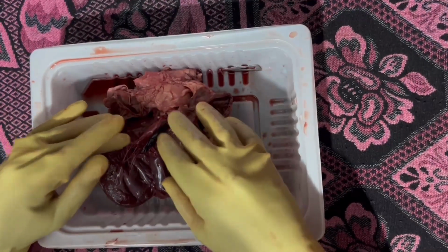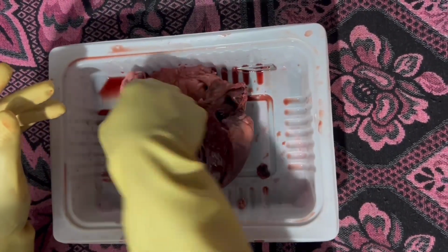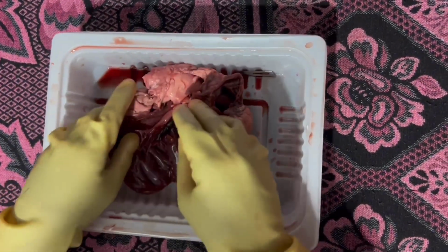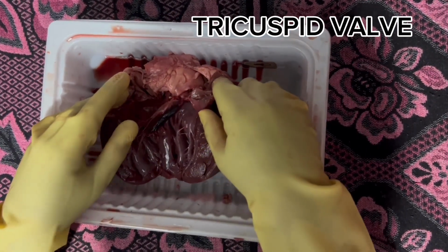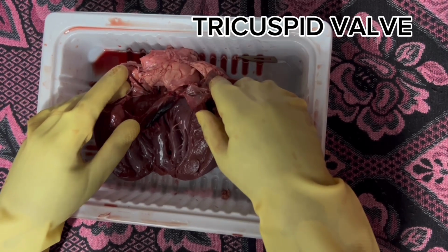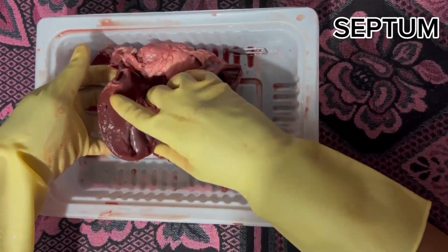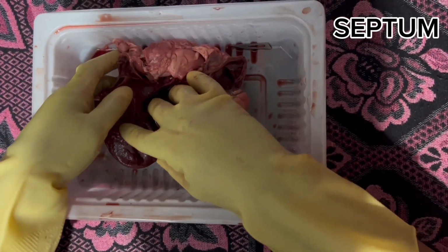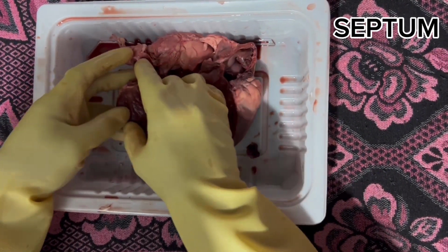This is the internal part of the pig's heart. This is the right atrium and the vena cava. And this is the tricuspid valve. It controls the flow of blood from your heart's top chamber to the bottom chamber. Next is the septum. This is the septum. Here is the thick wall that separates the two ventricles.